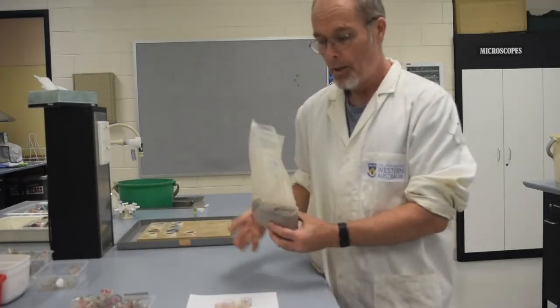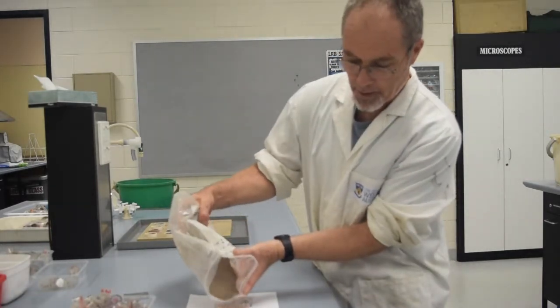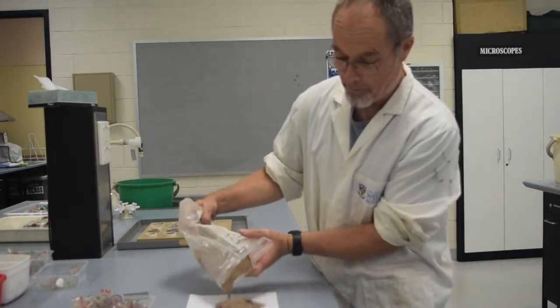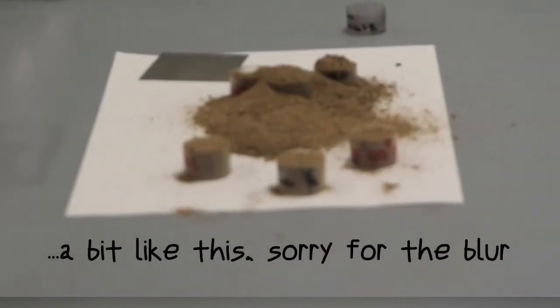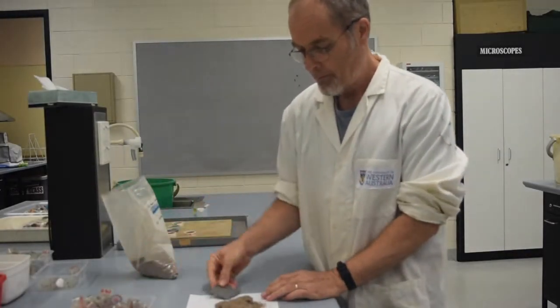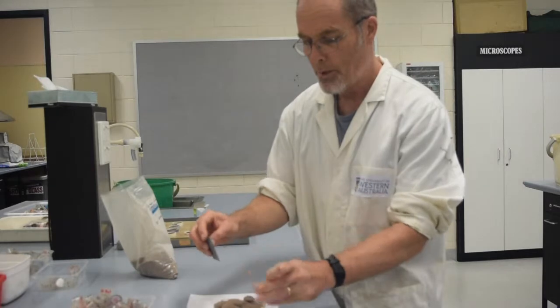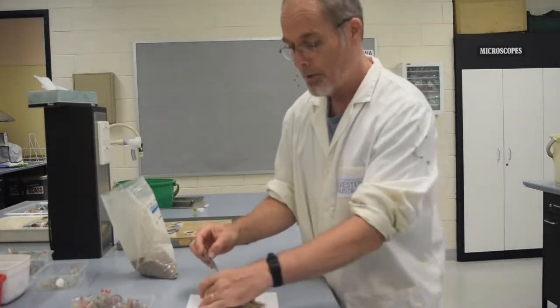The easiest way to weigh out seven identical samples is just to pour soil in to overflowing and then we're going to level them off, just like we're baking a cake with ingredients. A little bit more in this one here so they all get leveled off. The reason why we do this is that the vials have a known volume so that we can also calculate the density.